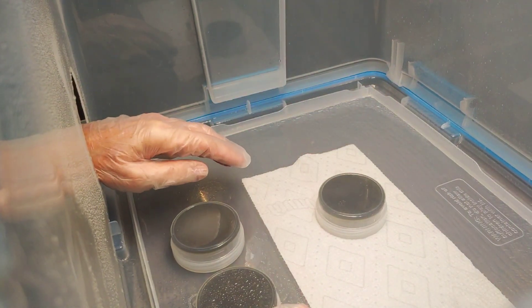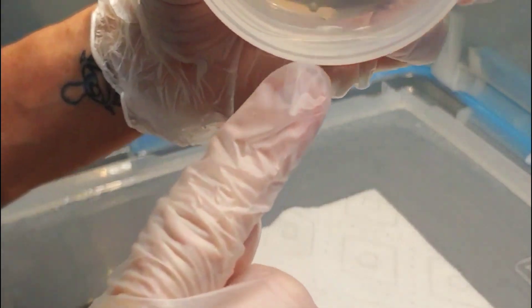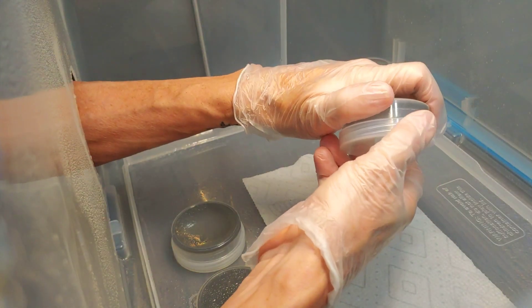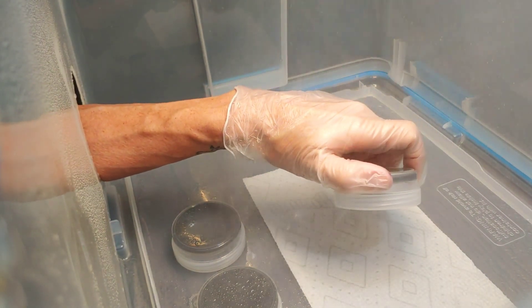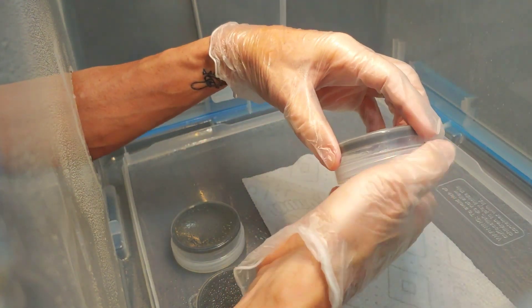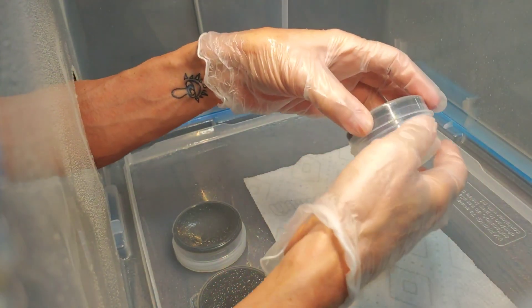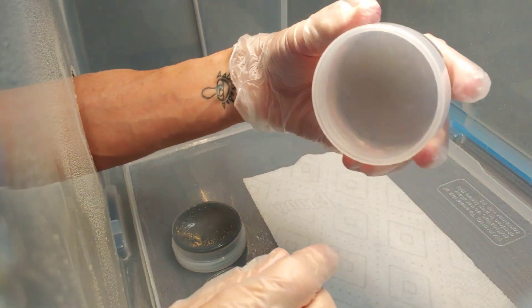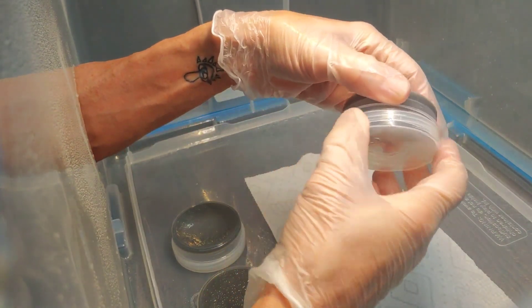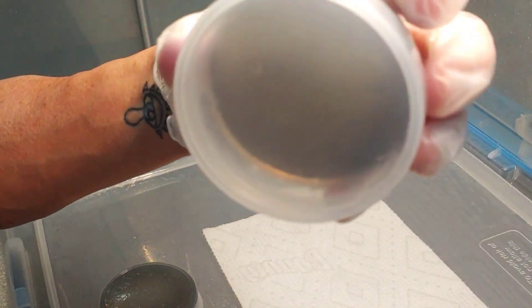These have been upside down for a couple days now and they've already lost most of the condensation. But if you notice down here, there's a little pool of water. What I like to do is get them in the spray area, spray everything down, keep them upside down so that little pool of water doesn't go up to the agar, then open them and shake that water off — tap them a little bit, not a lot. We want to do this quick, you don't want to leave this open for a long time — then tighten it back up tight.